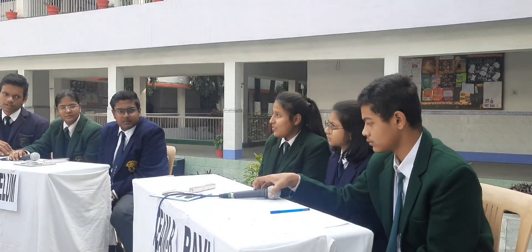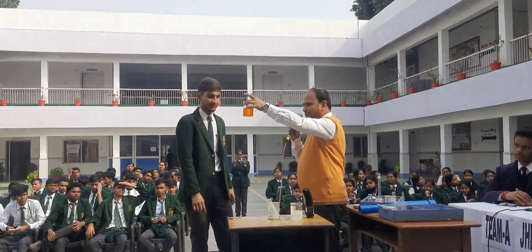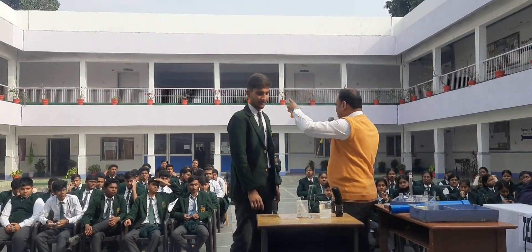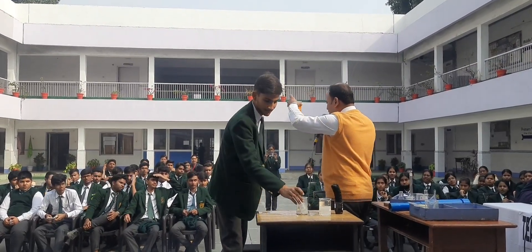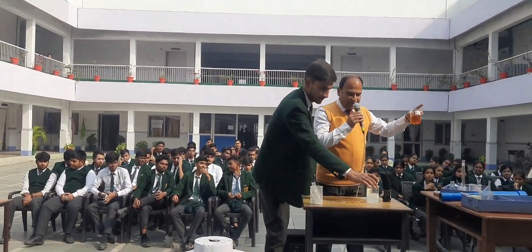Use the mic. What color is this? All of you? Orange. The audience says orange color. Okay, fine, this is orange.